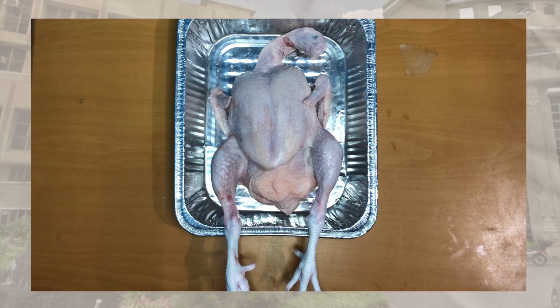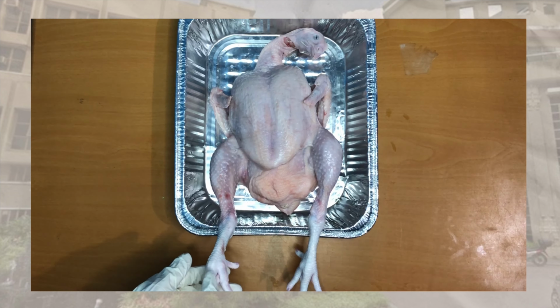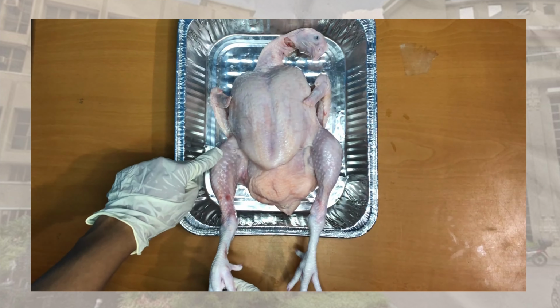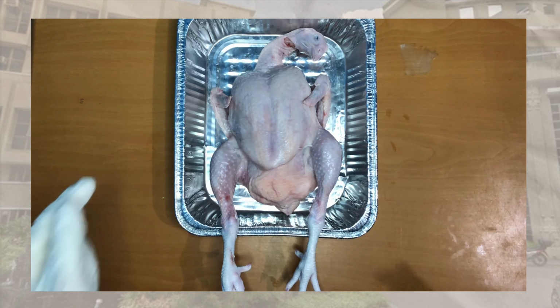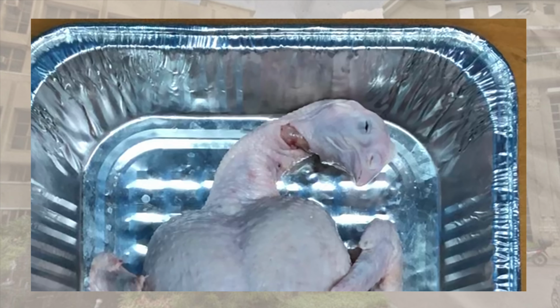Proximal is close to the origin of the body part. For example, the thigh is proximal to the feet, while distal is farther from the origin of a body part or the point of its attachment. For example, the feet are distal to the thigh. Superficial is the body surface, which is where we are looking now, which is the skin. And lastly, deep is away from the body surface, like the bones of the patient.